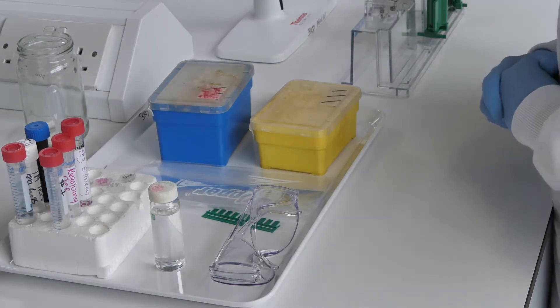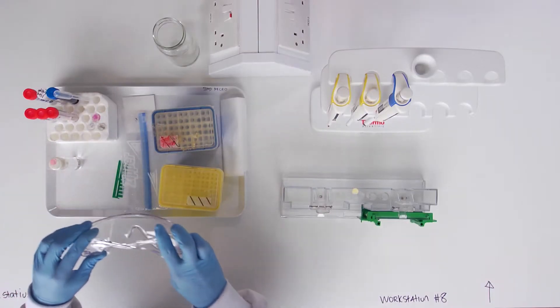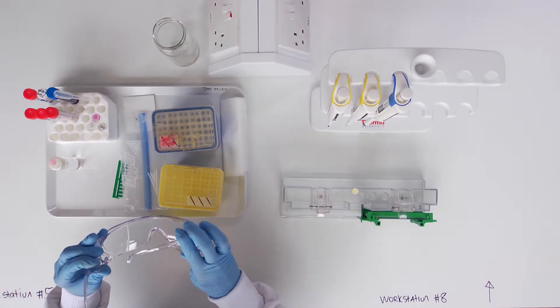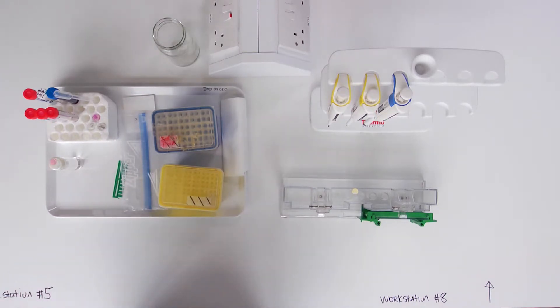The gel is prepared in three stages: the sealant gel, the resolving gel, and the stacking gel.